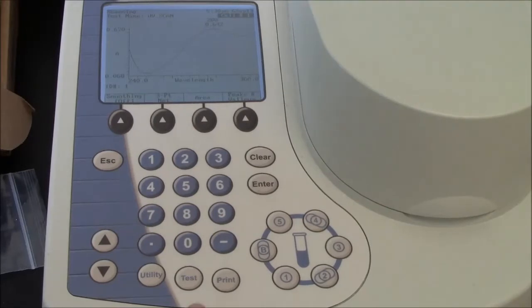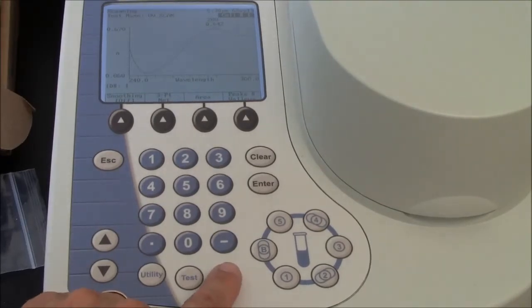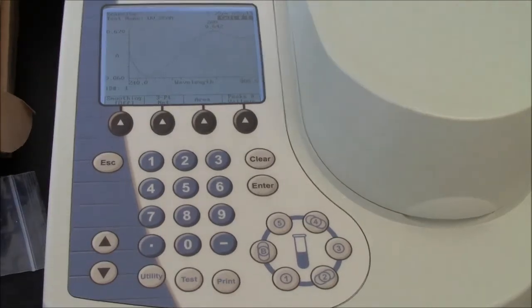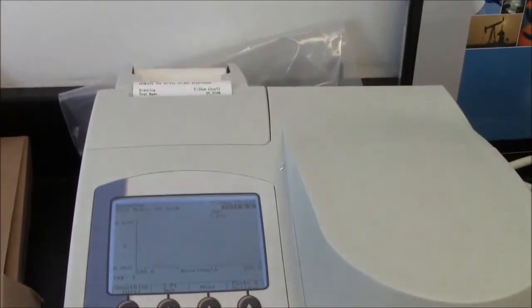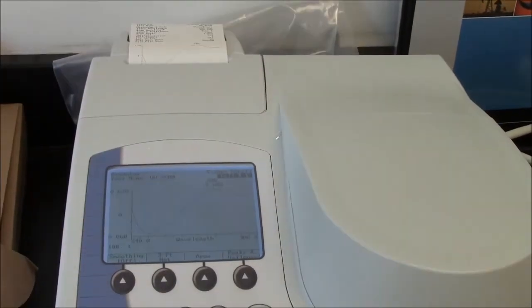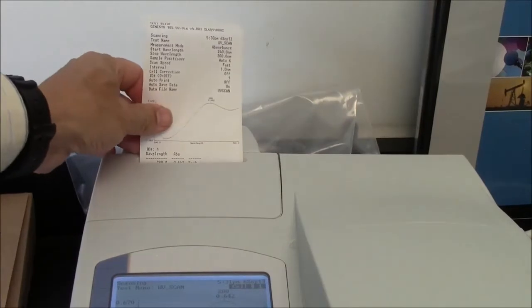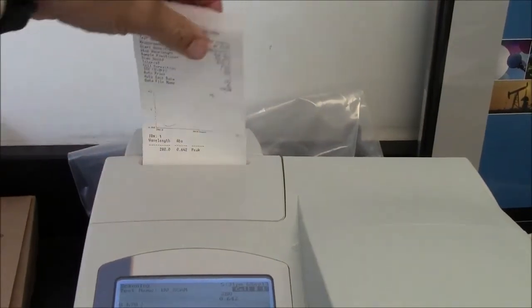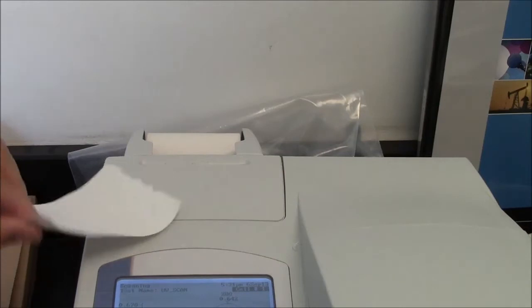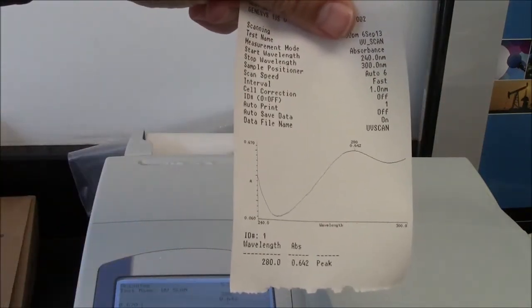At the bottom of the touchpad is a print button. I will print my graph. The printout appears here. I can pull this up and carefully tear.